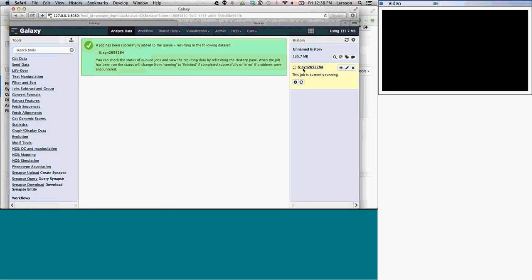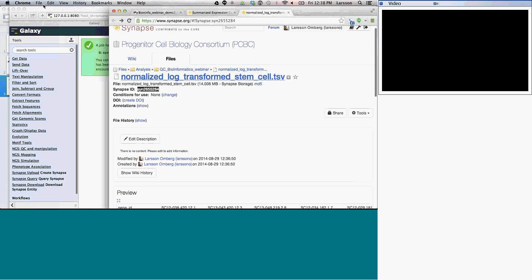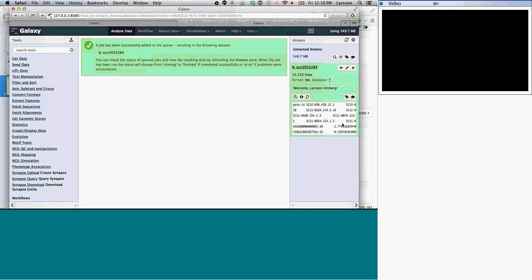So you can see the process going. The current job is running, and it's fetching this. If we move back to Synapse, oh, there it is. It was already done. So here we see the data set that I had just uploaded. Now you can use whatever tools you would like in Galaxy to perform the same thing. So, multiple interfaces; we could do the normalization in multiple ways, but I think this is one of them.